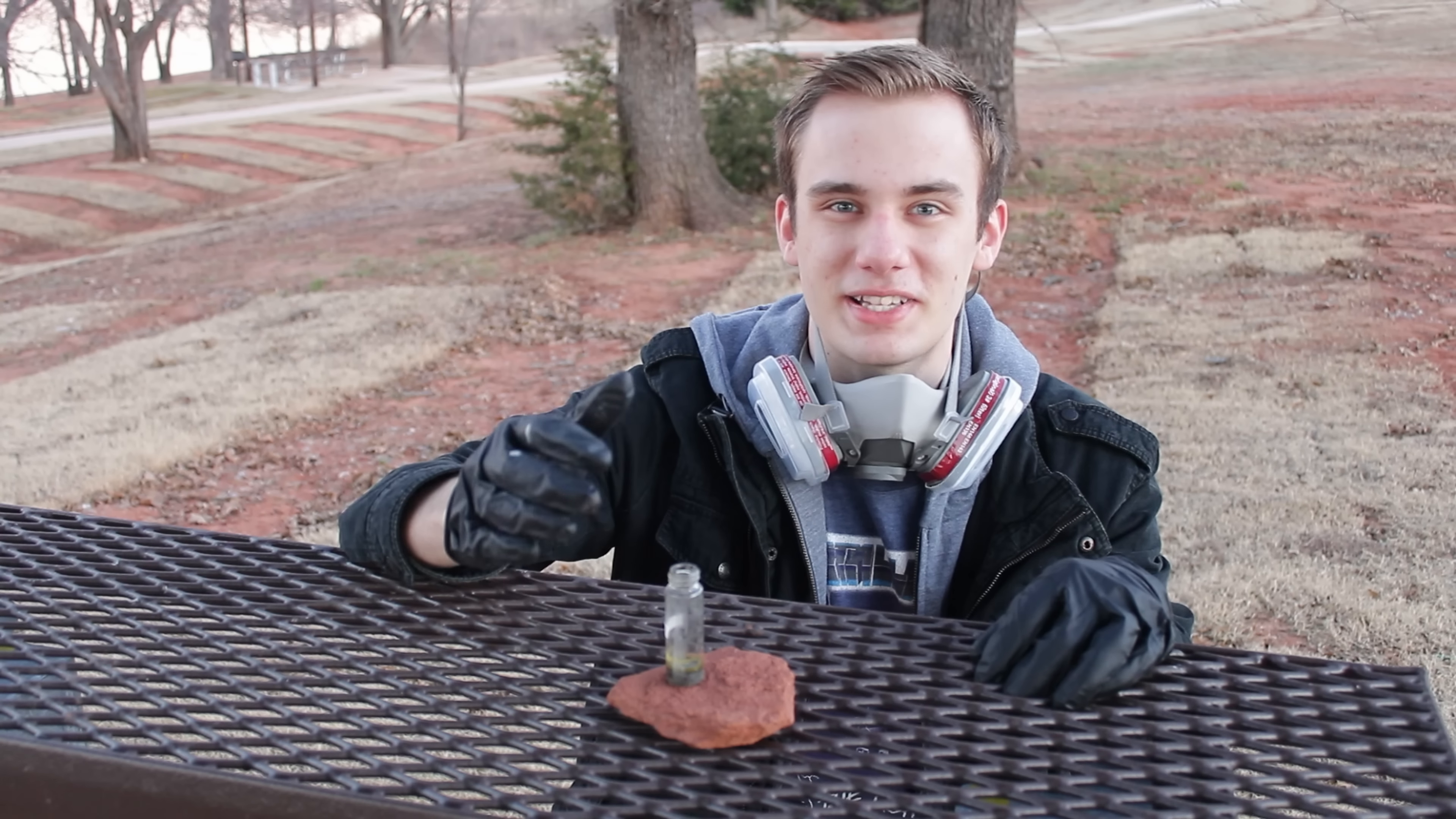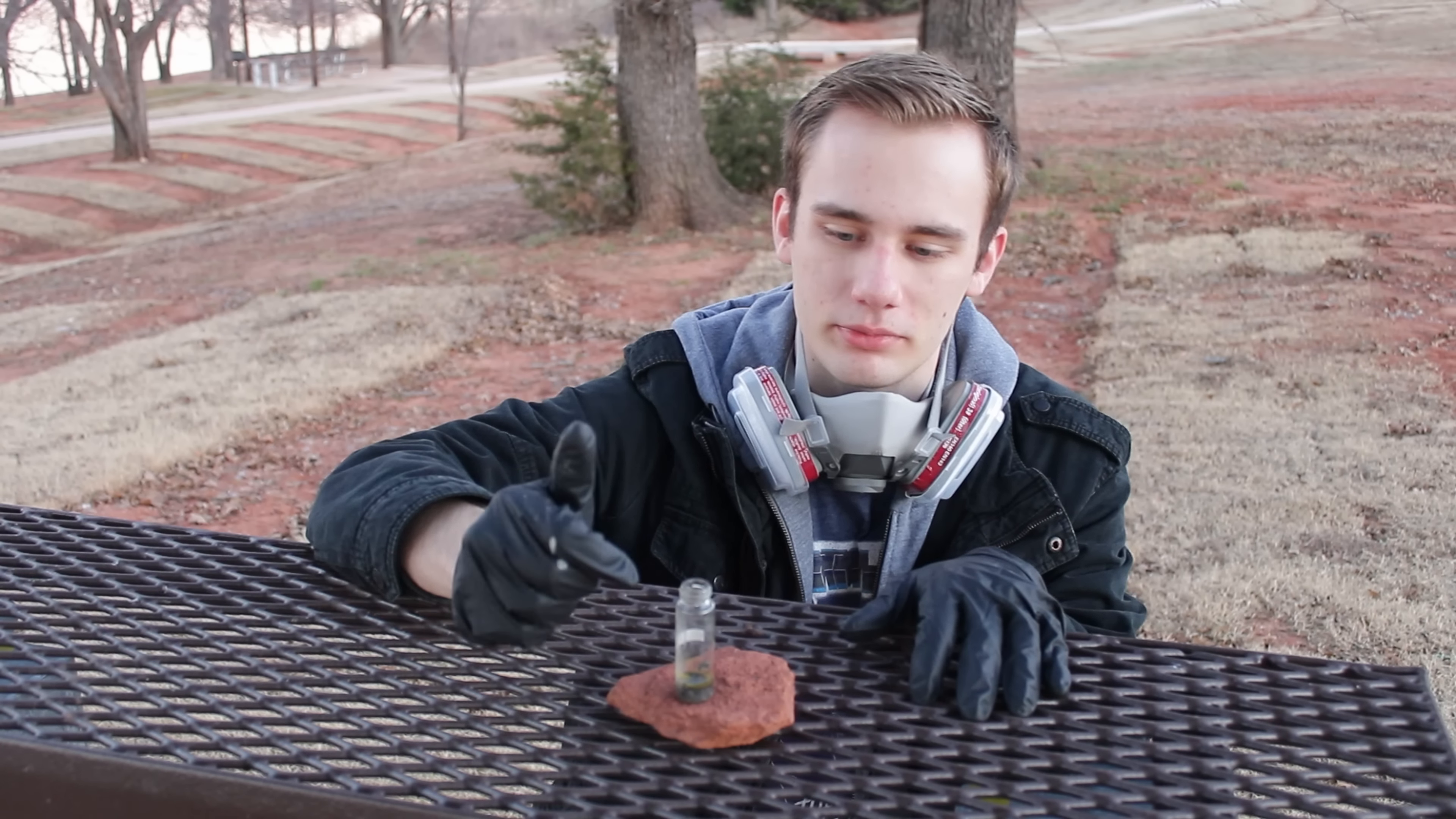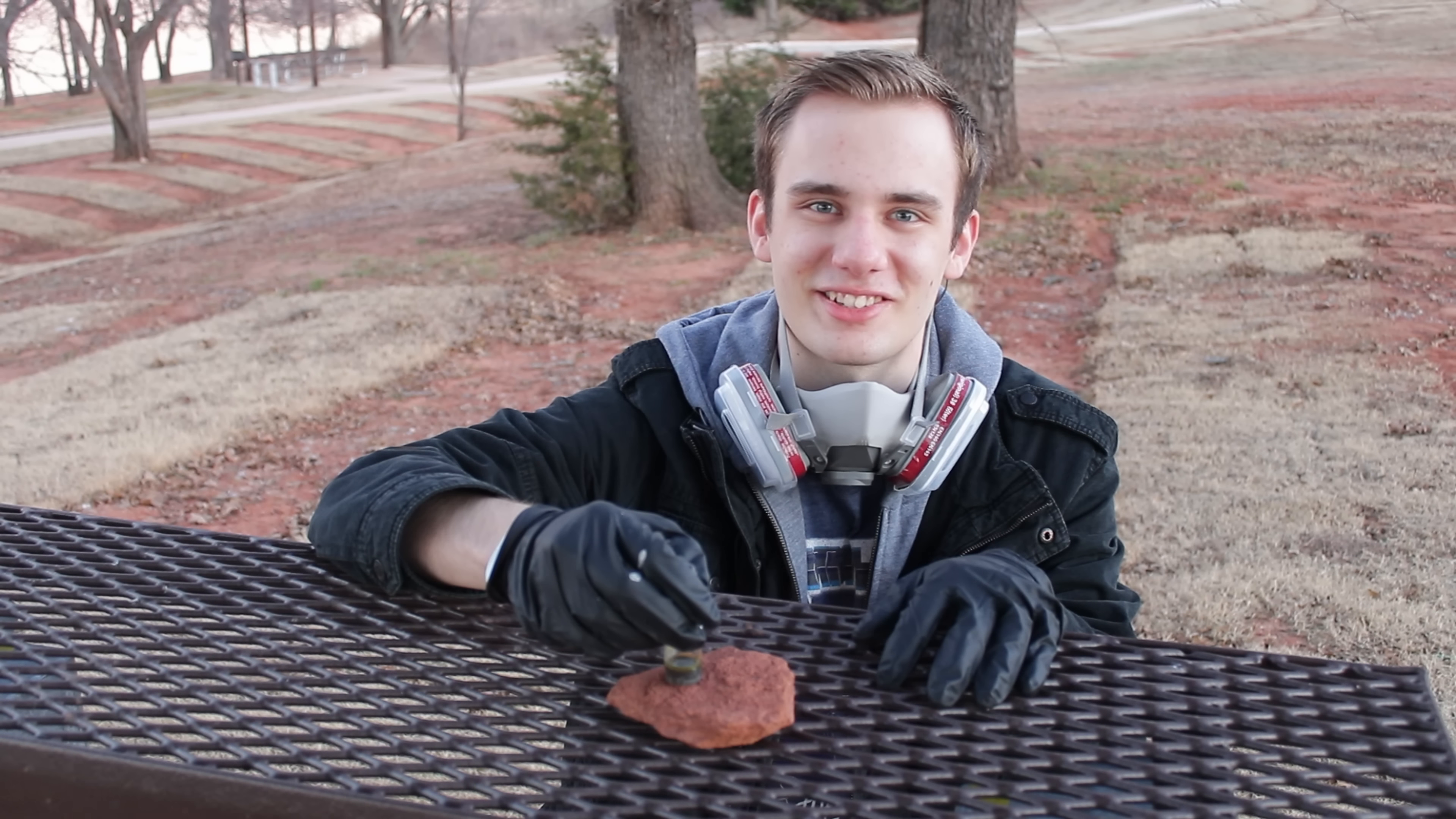The smell, like, it's similar to thioacetone. They're all similar in that range of kind of sulfur-y smell, even though there's no sulfur in this. It's like the Wikipedia article said. Very garlicky. It's like a very intense garlic smell. It's very different from hydrogen selenide, even though there's definitely some hydrogen selenide still present here. But it's just very garlicky, very disgusting. In our case, we got a kind of more yellowish oil instead of a red one. That might be just not sure why that might be. But it definitely, it's definitely unique from hydrogen selenide, so we got the selenoacetone.